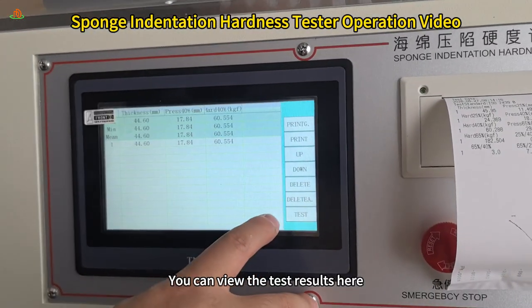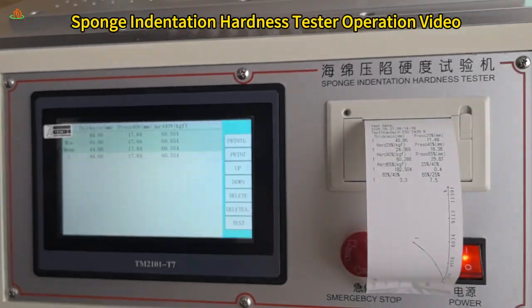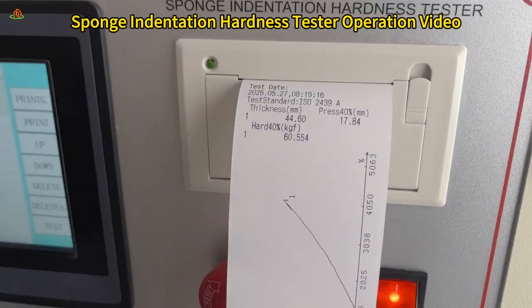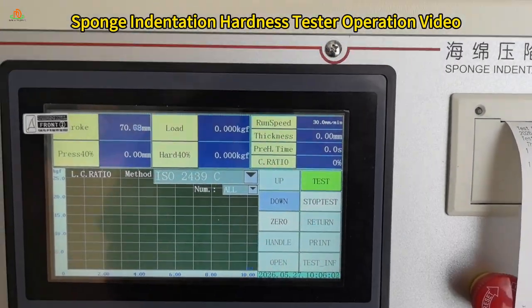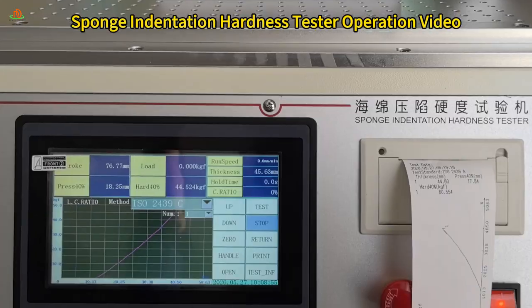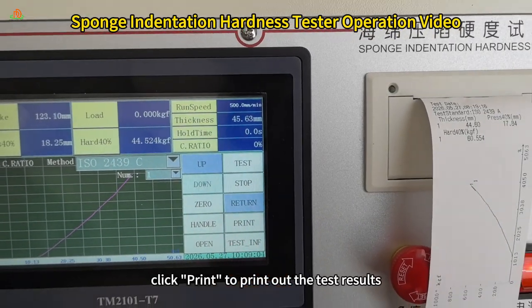You can view the test results here and click Print to print them out. Next, test method C. After the test is completed, click Print to print out the test results.